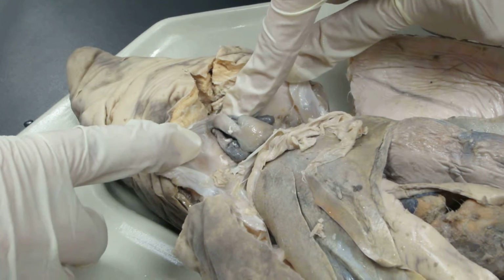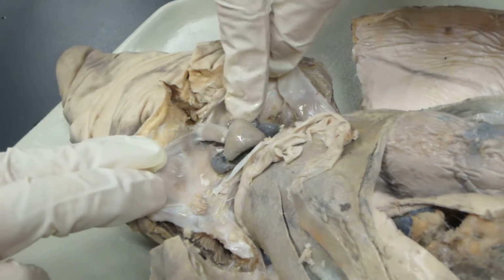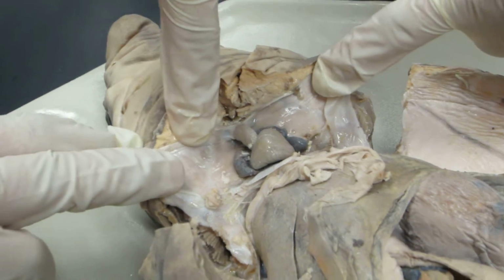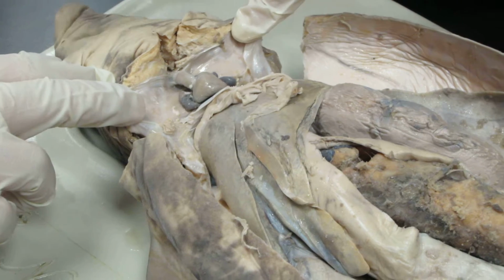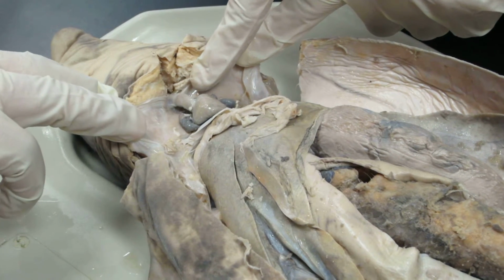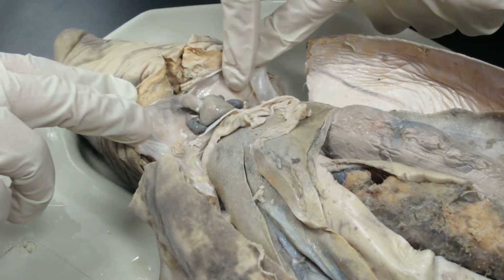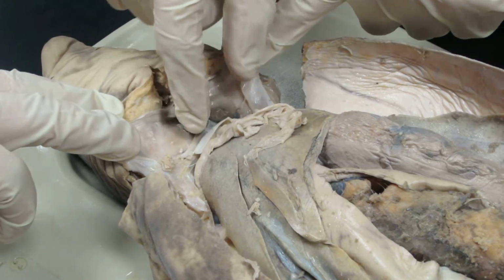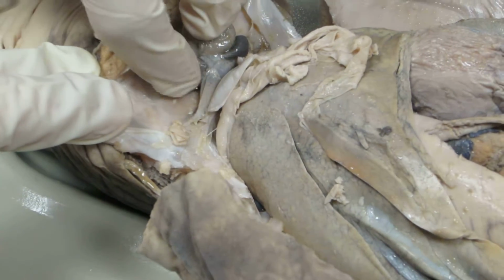If you could kind of see the two arches, it's not well cut out, but you see that one branches to the right, one branches to the left, right? Okay, and then dorsal to the ventricle, one sees the thinner material that forms the wall of the atrium. So the atrium is right here. The darker ones, yeah.